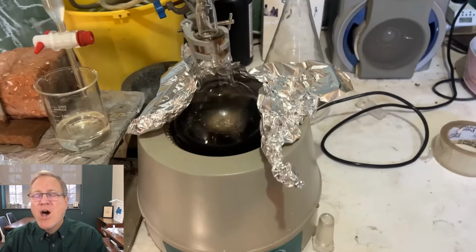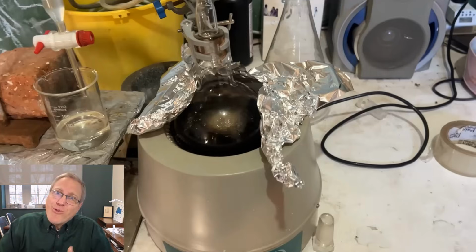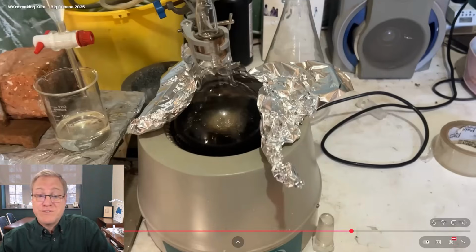I want you to notice how much he's thinking about what's going to happen. Because there's a lot of things that could happen, and he's trying to anticipate all those contingencies and thinking, what action can I take now to minimize the problems down the road? When you do experimental work, whether it's experimental chemistry or experimental physics, you're constantly thinking about how can I save myself problems down the road? Because sometimes problems down the road are really hard to fix. So maybe a little caution up front can, an ounce of prevention is better than a pound of cure. So he's just thinking through things and anticipating problems.